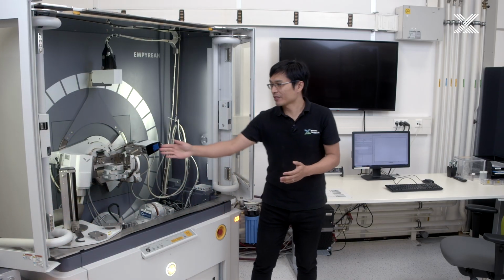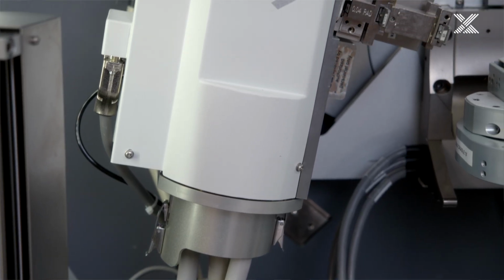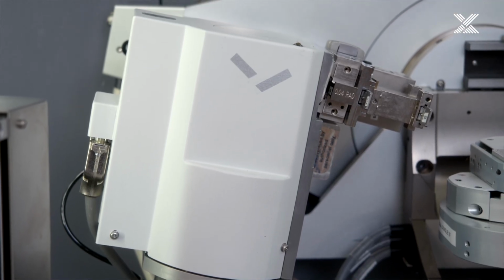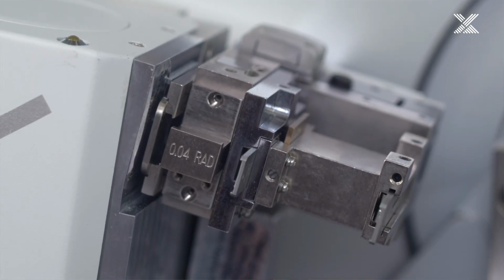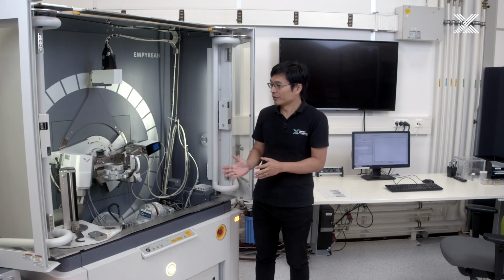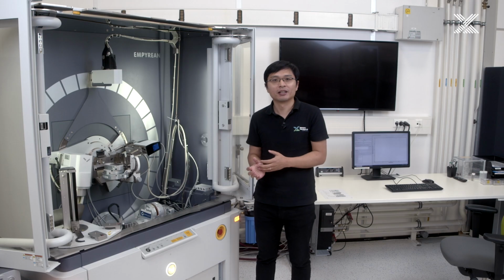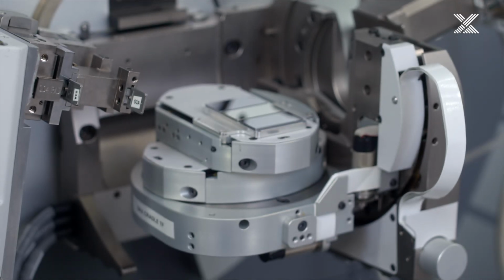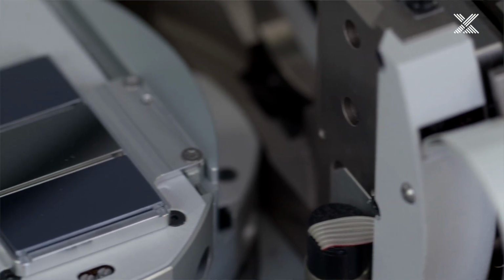First of all, on the left side, we have the enhanced stability tube, which gives the focus spot. And then after that, we have the primary beam optics, which confine the beam's height and beam width before the beam arrives at the sample stage. When you look at the sample stage part, which is a bit different from the typical XRD measurement, we have different options from the manual stage to the automatic stage. In this case, we have the 5-axis crystal stage. In this stage, we can put different crystals on top.